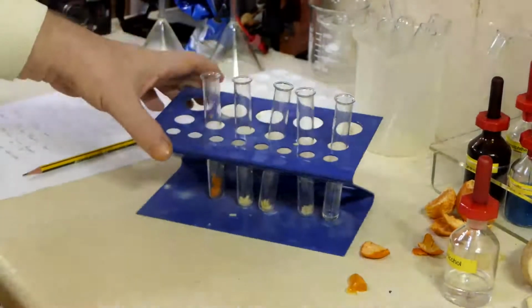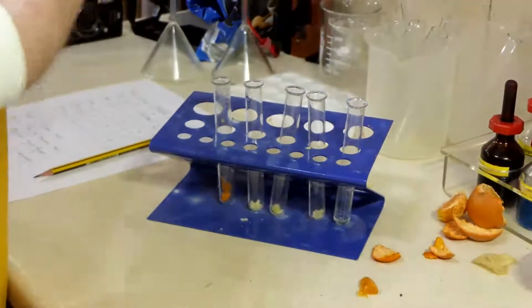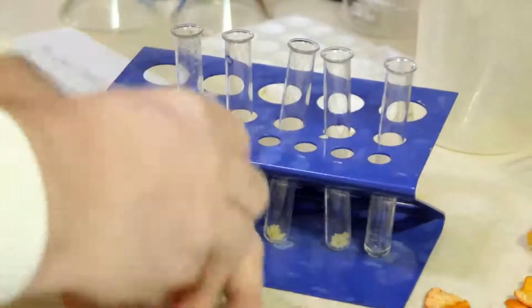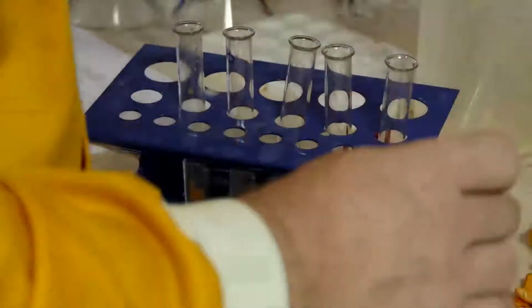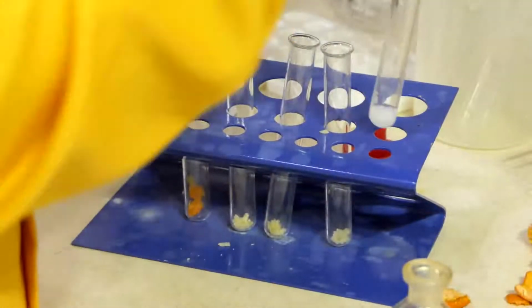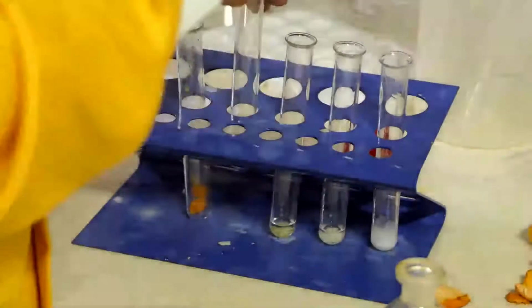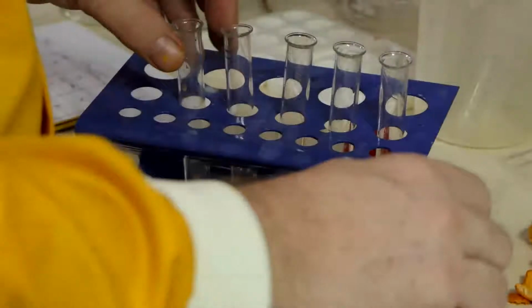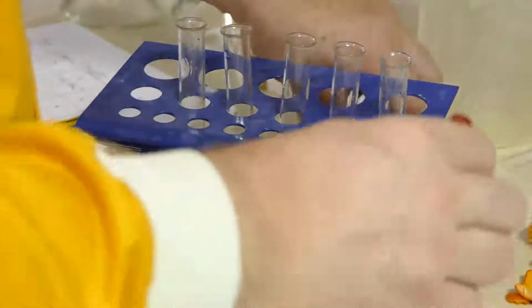Now, let's look at alcohol. So I'm going to squirt alcohol here. Sweet.